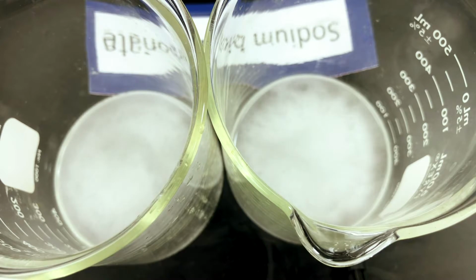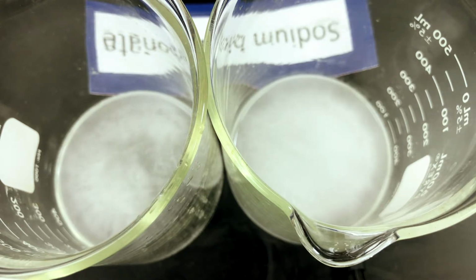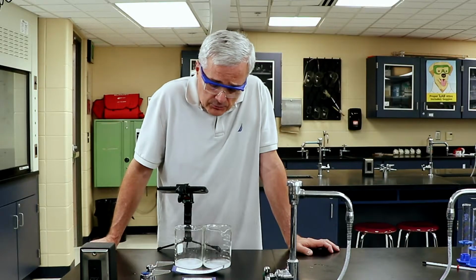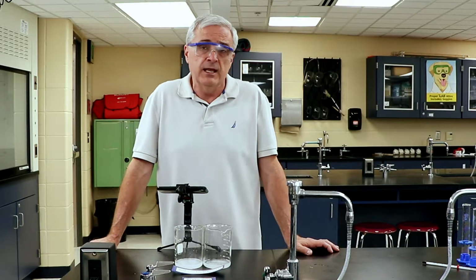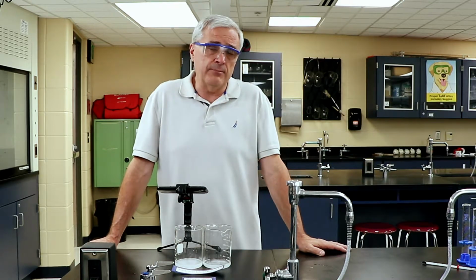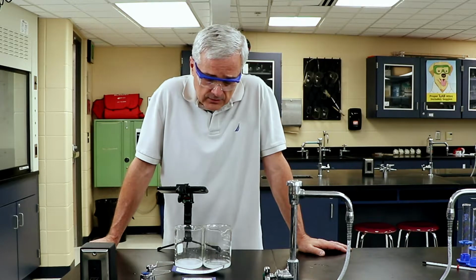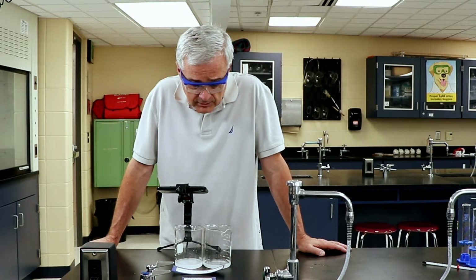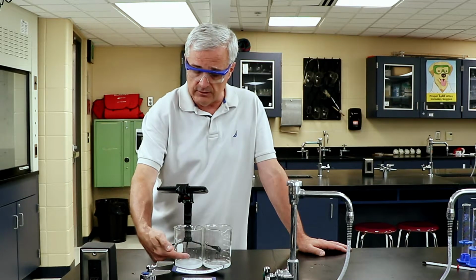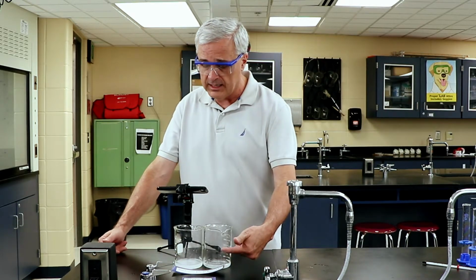One thing that you can observe is the size of the bubbles in the cold reactant; they seem to be smaller. And that's not really part of this experiment. But one thing that happens when you do science is you look at the results of your experiment, and sometimes that will trigger other questions. And there may be some hypotheses and guesses as to why those bubbles appear to be smaller in the cold side. This is the cold side over here, and this is the warm reactant here.